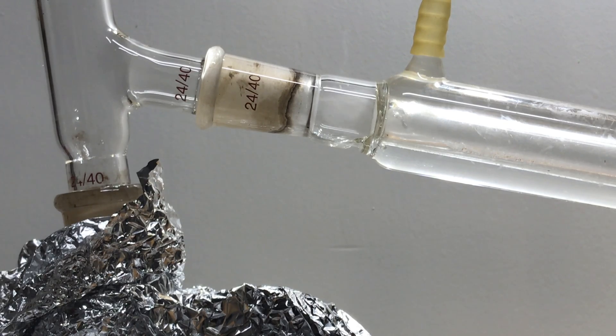Black solids have accumulated, and I honestly have no idea what they are. If any of you know this, let me know in the comments.